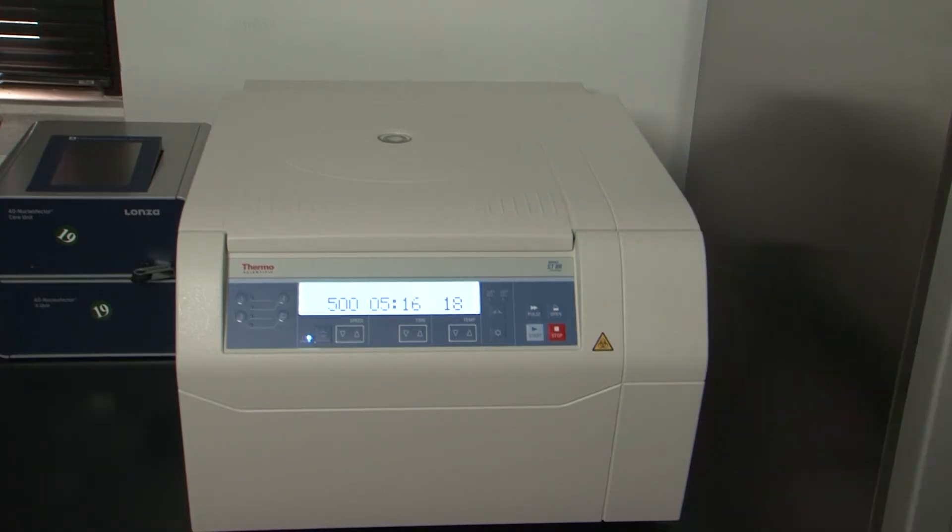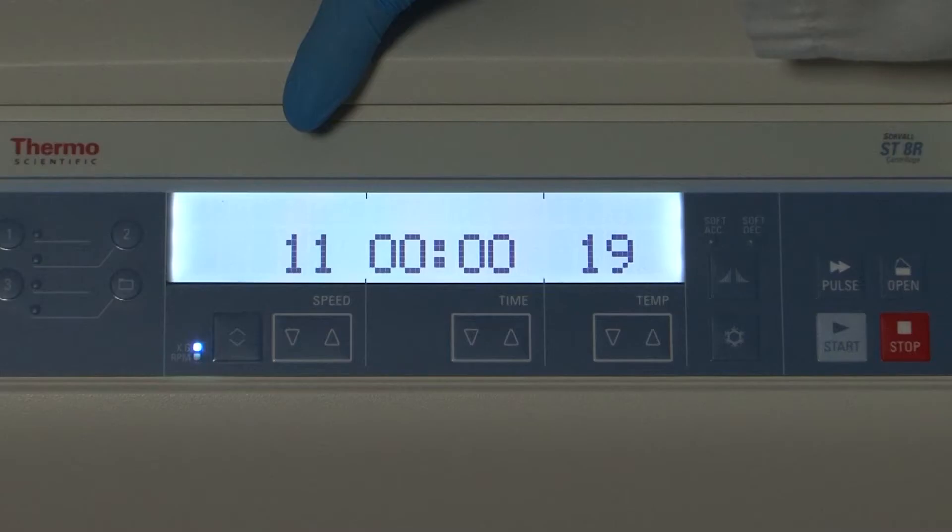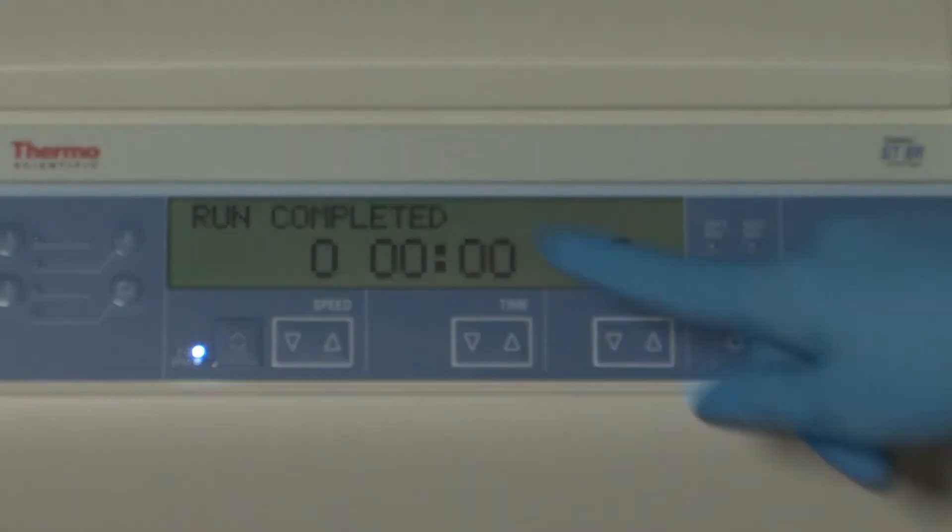Ideally, the brake of the centrifuge should be off in order to avoid disruption of platelets. Allow the centrifuge to slow and come to a complete stop before opening the lid of the centrifuge.